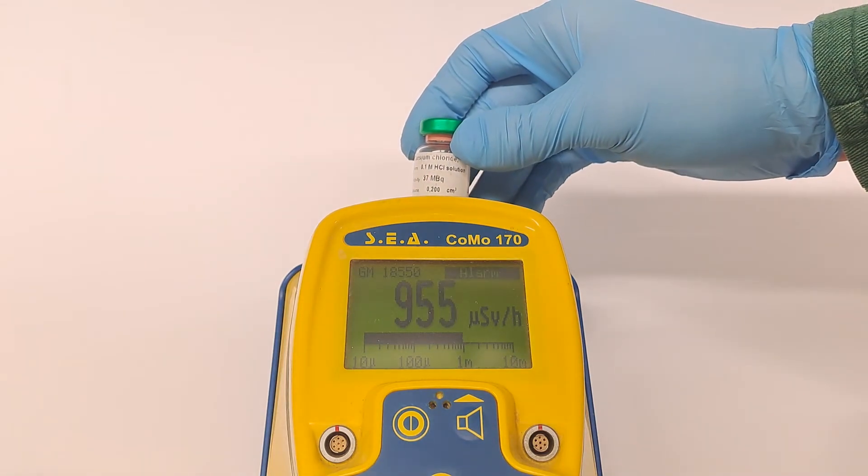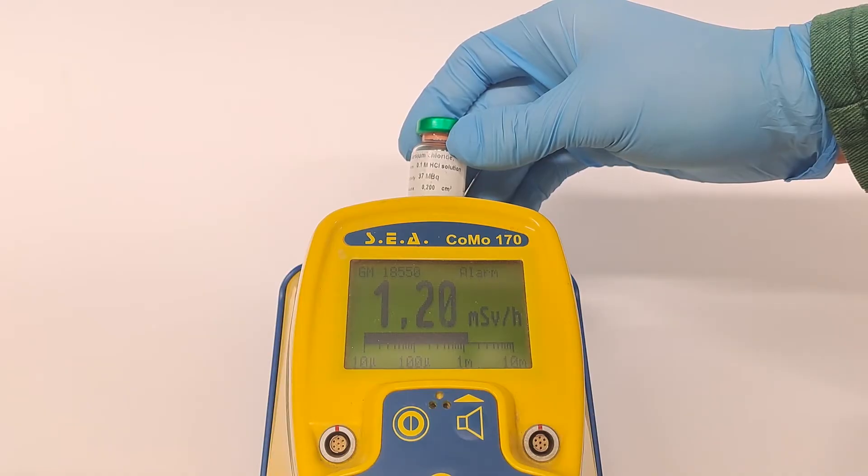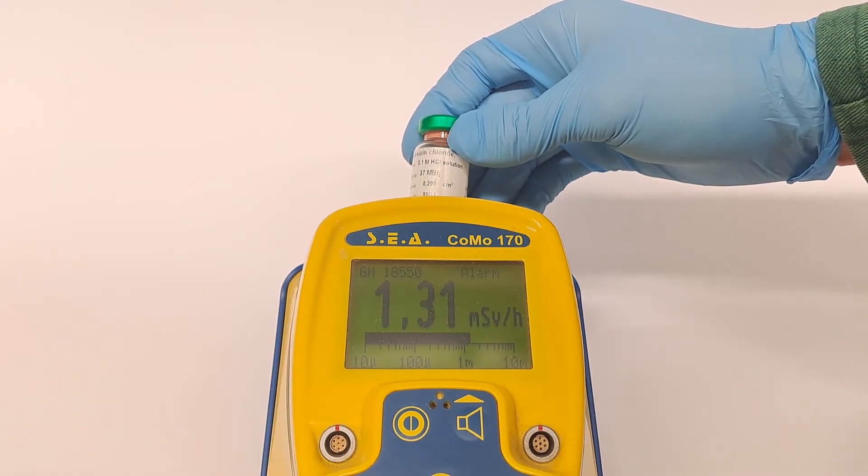No, this nitrile glove I'm wearing won't protect my fingers from the radiation at all. I will just hurry with the measurements.